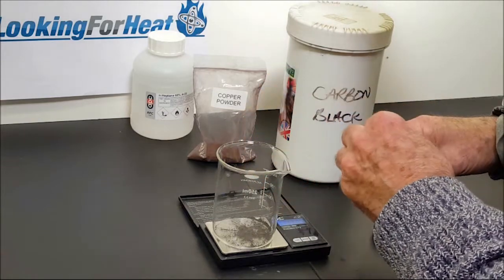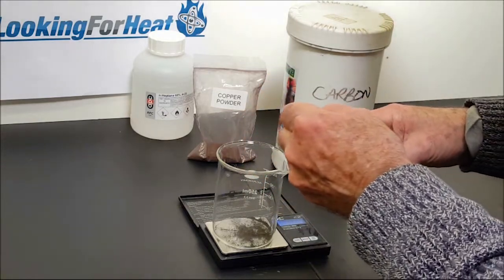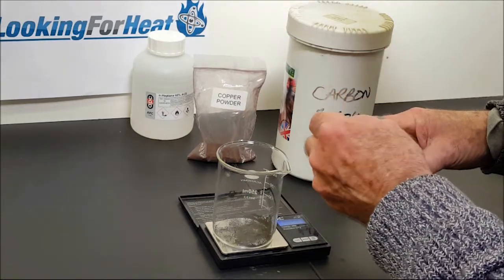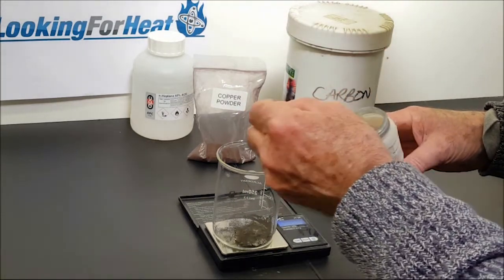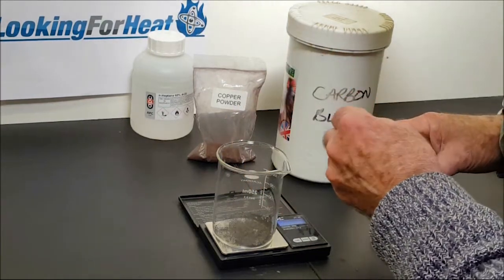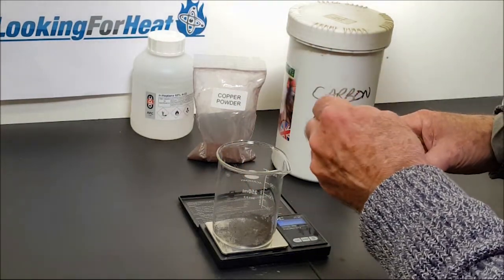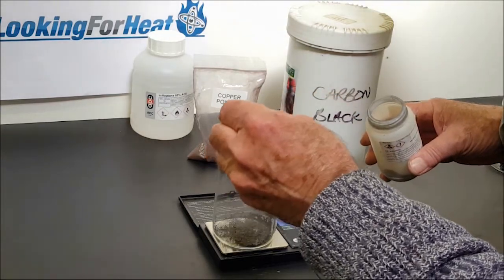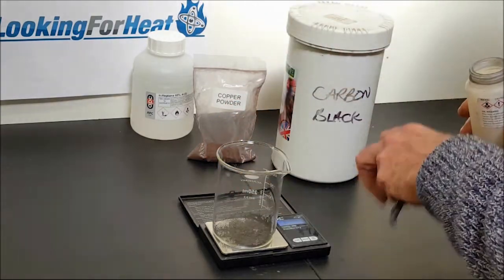This is gem grade nickel, 20 micron. Weighing out 5 grams. 5.13, close enough.